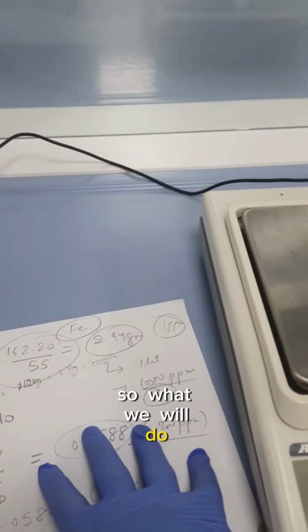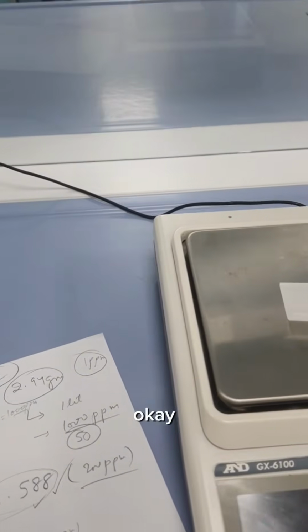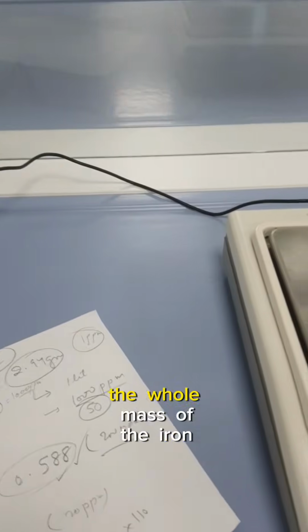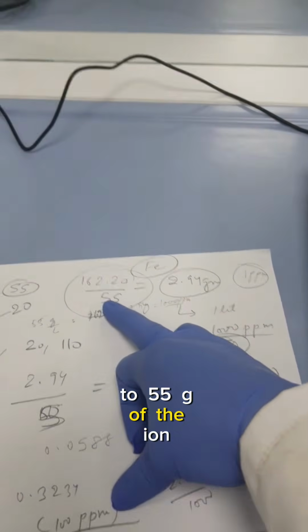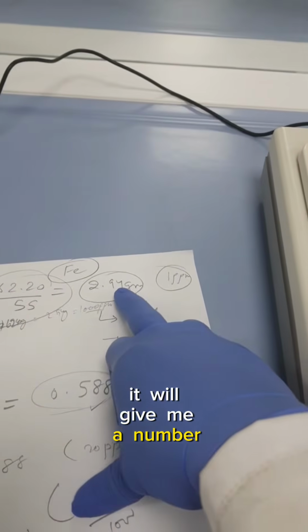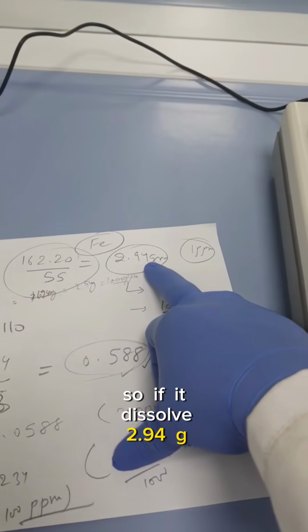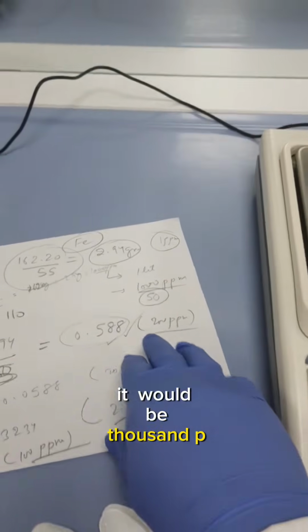So the whole mass of the iron chloride is almost equivalent to 55 gram of the iron. If we divide this, it will give me a number which is 2.94 gram. So if we dissolve 2.94 gram in 1 liter of the deionized water, it would be 1000 ppm.